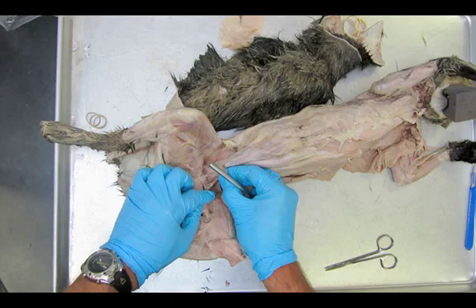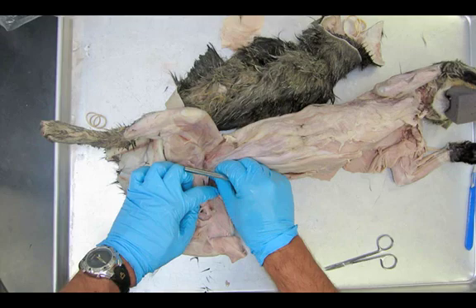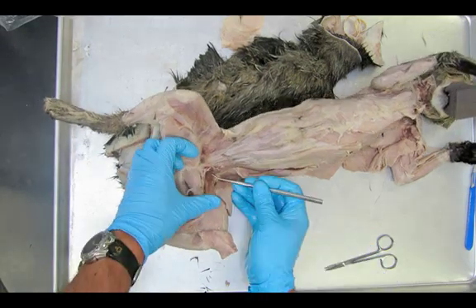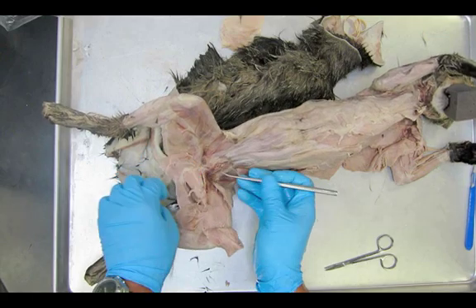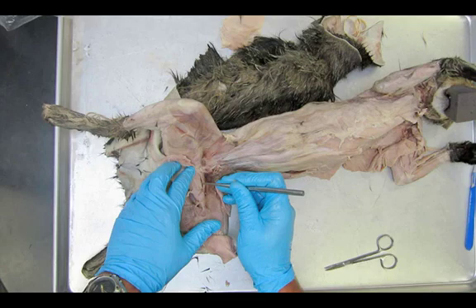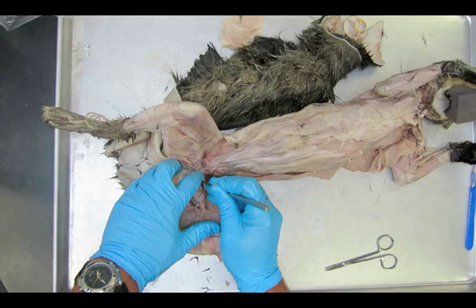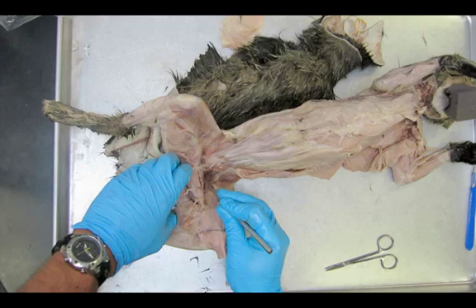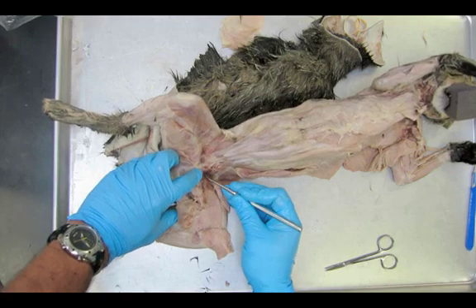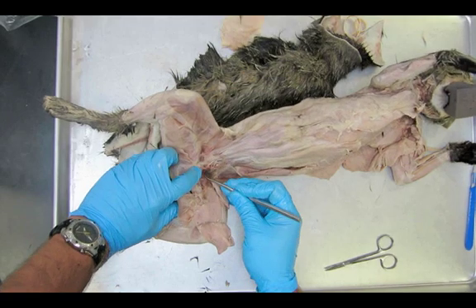I lift up this blood vessel and it pulls up some of the connective tissue with it. I'm cleaning up the stuff on top of the adductor longus. Then I'm working in between the adductor longus and adductor femoris, making that gap nice and clear. The pectineus is almost impossible to see — you're going to look for a very faint line. It's all dark red down in there and you have to find where the pectineus is.